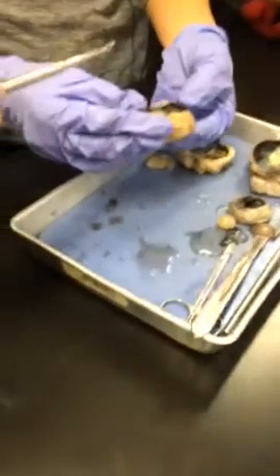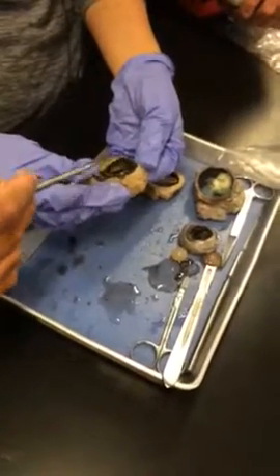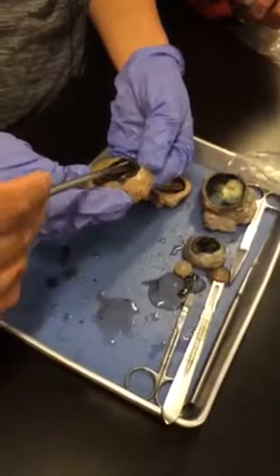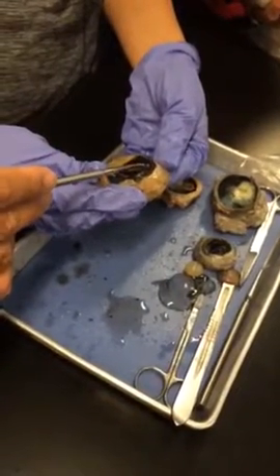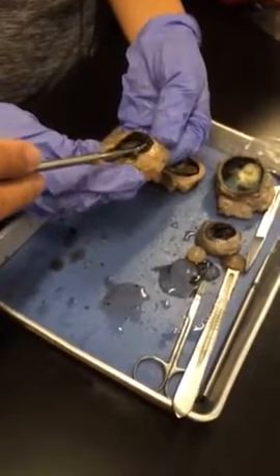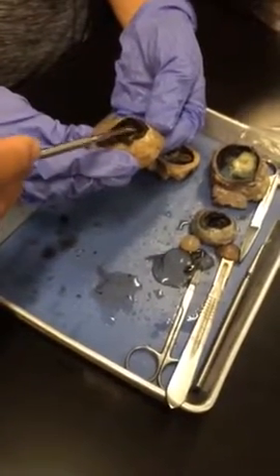There you go. So, if we're thinking about the cavities of the eye, what cavity would this be in general here? Anterior cavity. If I put the probe in front of the lens but behind the iris, though, where am I at? Posterior chamber of the anterior cavity. And if I put it in front of the iris but behind the cornea, what? Anterior chamber of the anterior cavity.